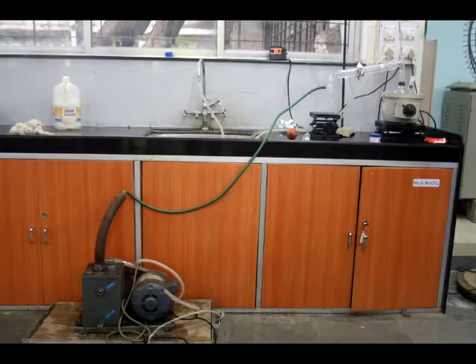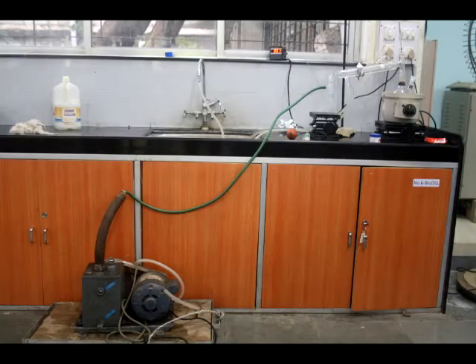Finally, we perform vacuum distillation on the remaining product to obtain pure biodiesel.